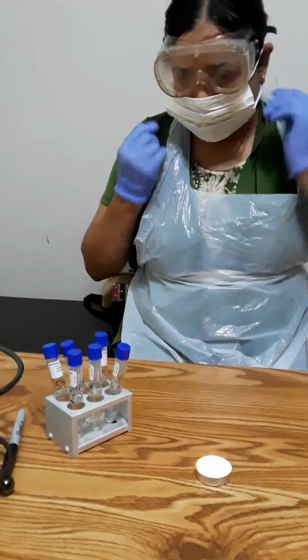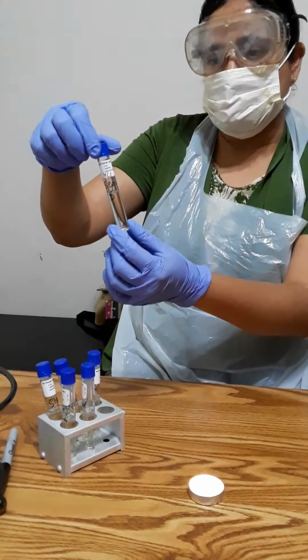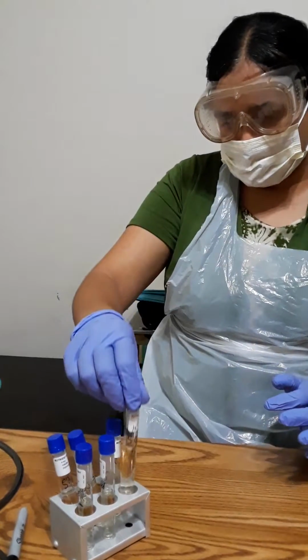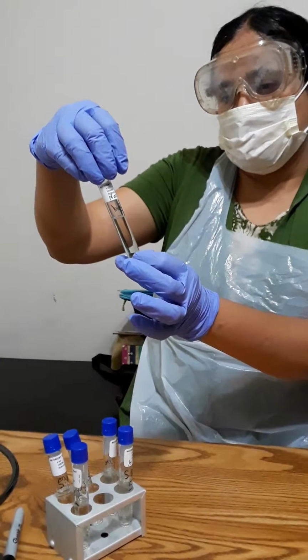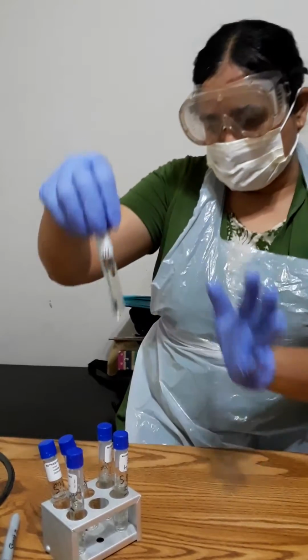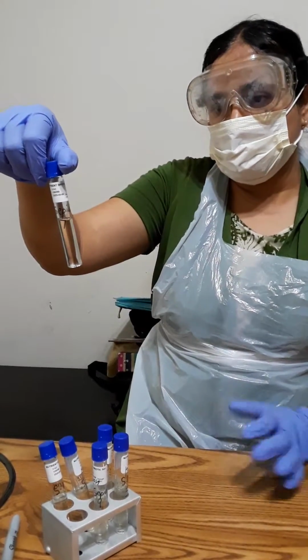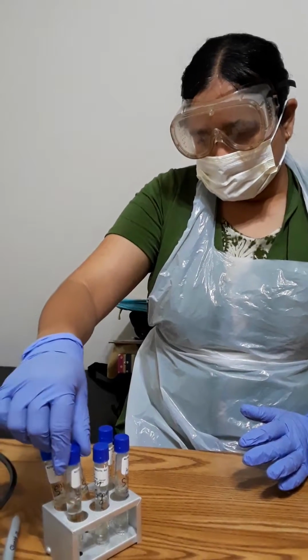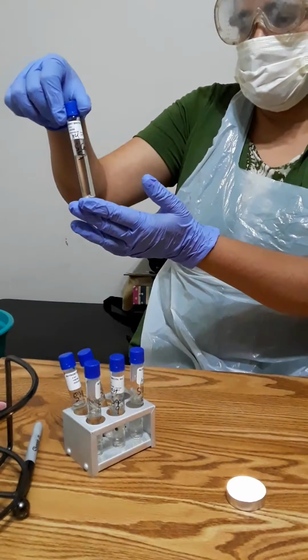So you can see my 6 tubes. This is for S. epidermidis and this is tube 5, in which I'm going to make it acidic by putting 1 drop of HCl. And this is the second tube for S. epidermidis, labeled as 9. I'm going to put NaOH here, that is alkaline, and this one is neutral. So I label the tube as 7. So 7 will be the neutral pH, and so these are acidic, alkaline and neutral, and same thing with this.